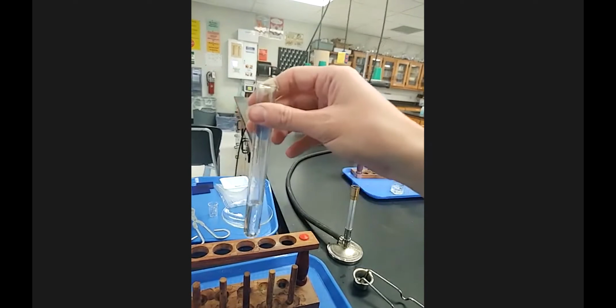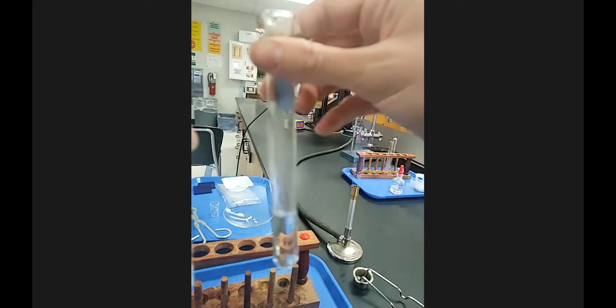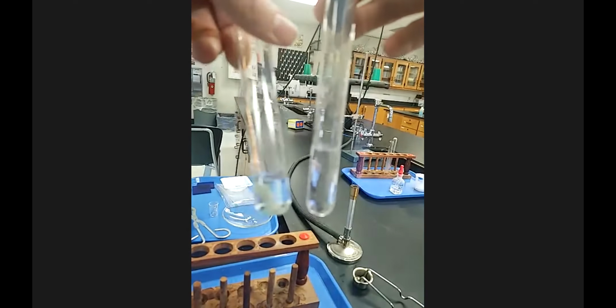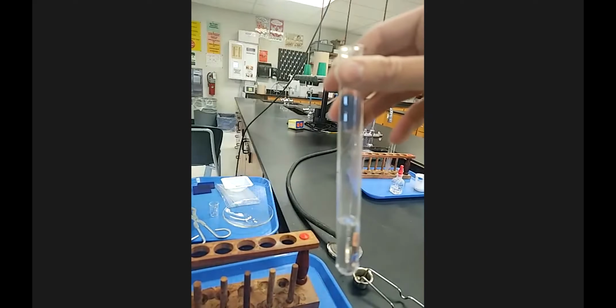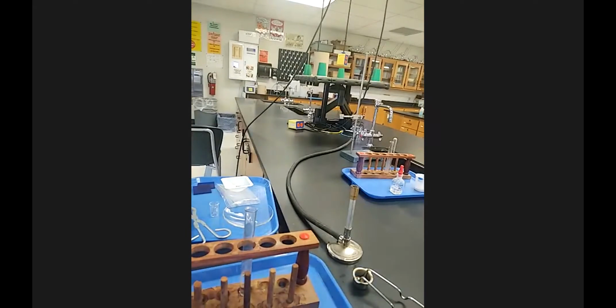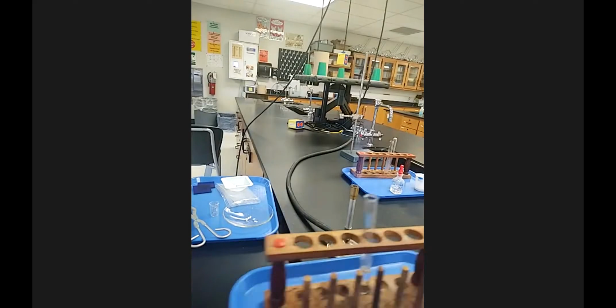So there's that. And then here, again, this is from station 1, just to show you visually the tint on station 1 versus this one, which just had the hydrogen peroxide and the bleach there. Who doesn't want to look at this? It's so pretty. It won't stay pretty forever. All right, that's station 3.